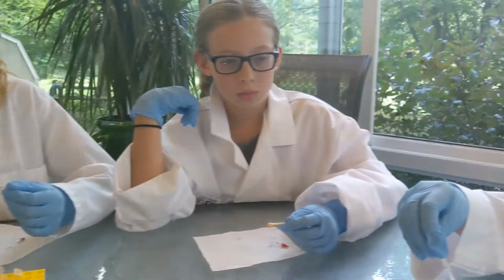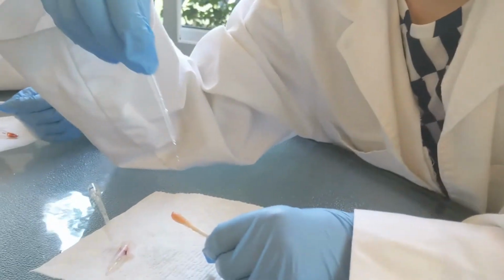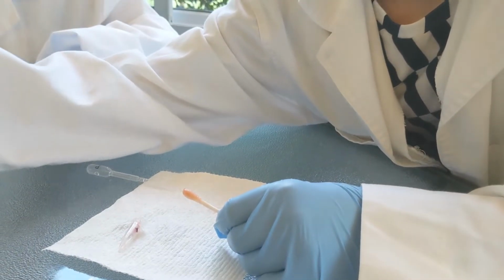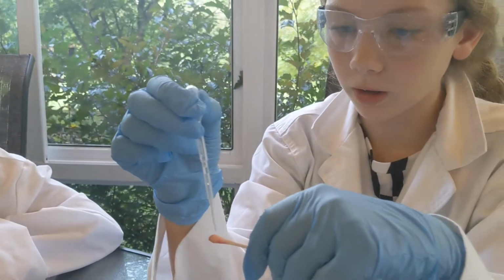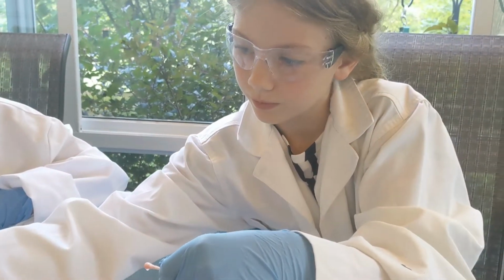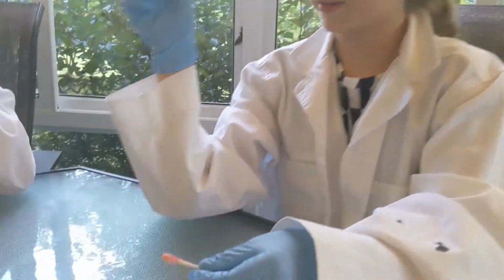Well, someone has the positive. Who has the positive today? Lily has the positive. I see her tube says positive. So we're going to compare the other ones to the positive, because whatever hers looks like, if yours looks like it, it means it's also positive for blood. It's already turning purple. All right. So one tip is teachers might want to have students use micropipettes, because we did have some issues with purple. I think mine's the only one that turned purple.